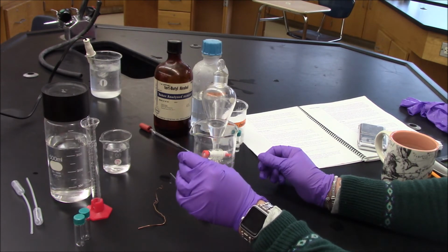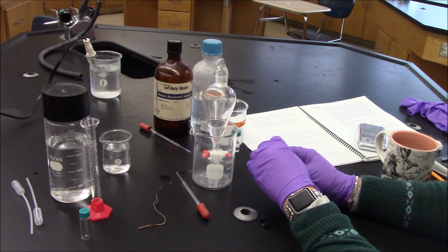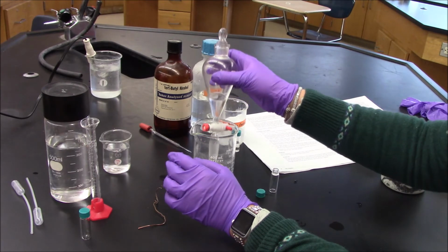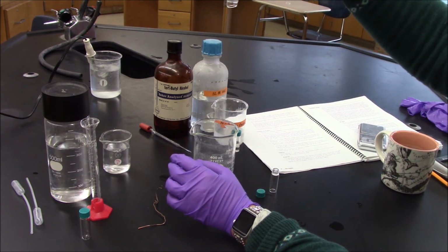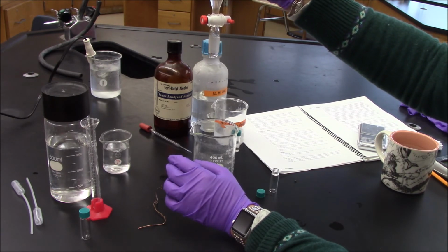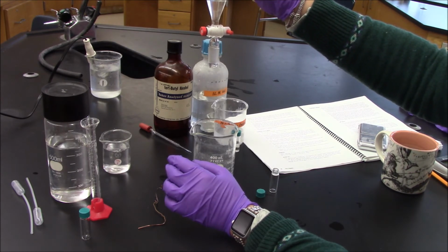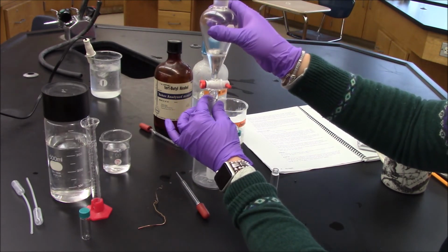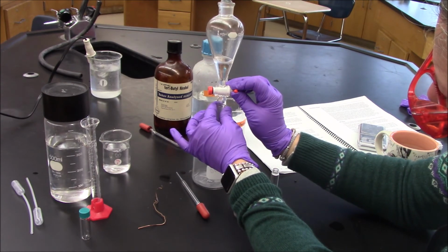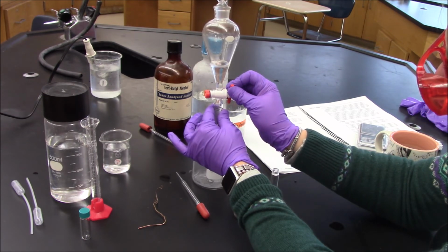While I let these layers settle, I have a second reaction vial. Clearly have an upper layer here. Now I could do this in one of 2 ways. The purpose of a sep funnel is to be able to drain and separate 2 layers. So what I can do here is I can carefully drain the lower water layer as best I can.